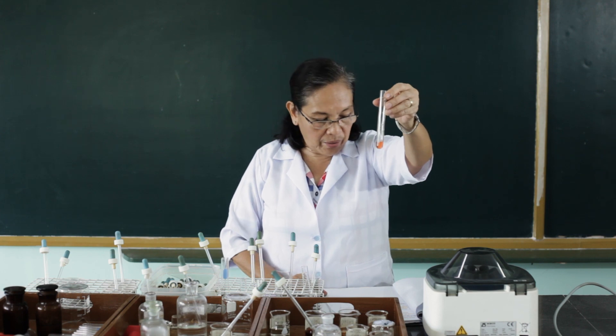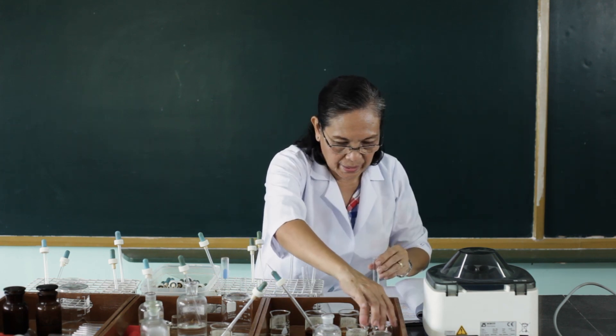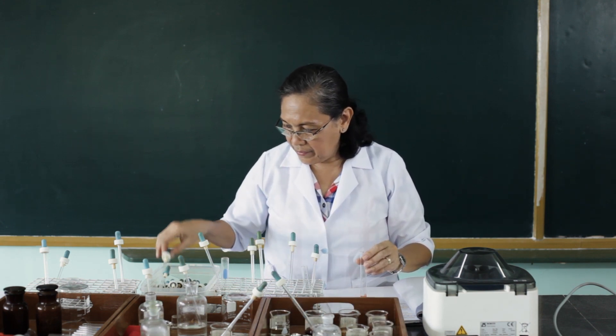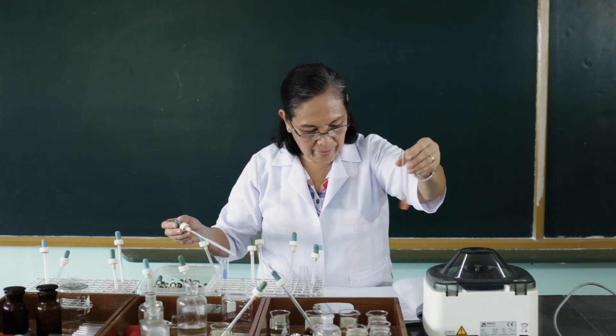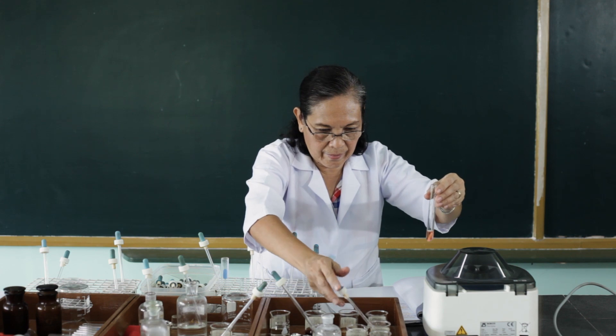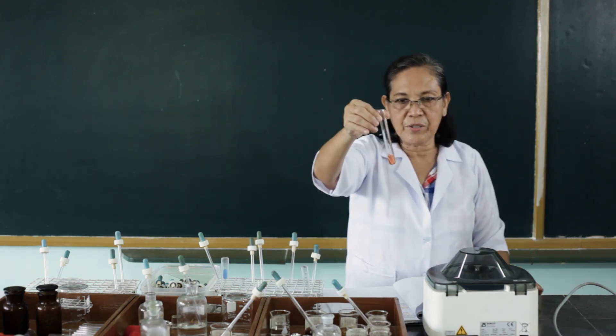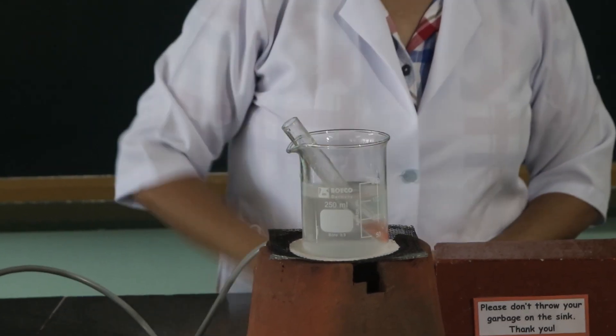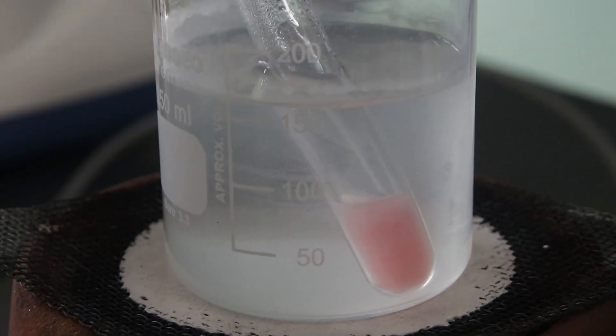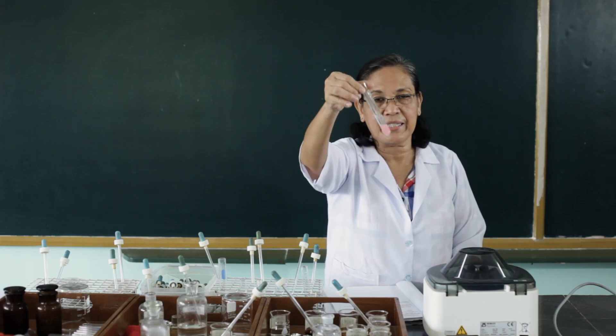Then we will add five drops of thioacetamide to this. After adding this, we're going to warm this in the water bath. Observe what happens to the mixture after it has been placed in the water bath.